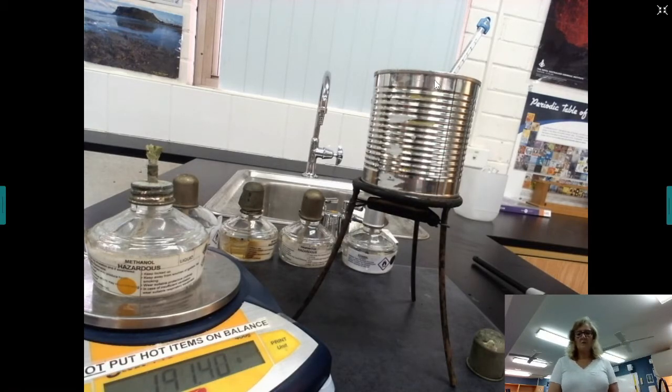Okay, so I will continue working through this for the other 4 alcohols, and I will give you a set of data that you can use for your analysis.